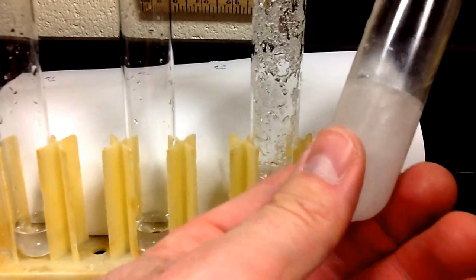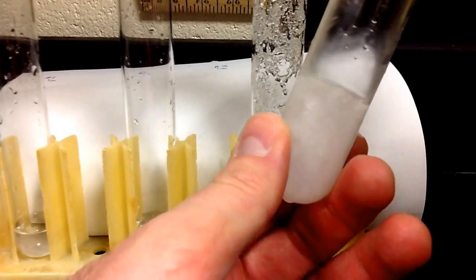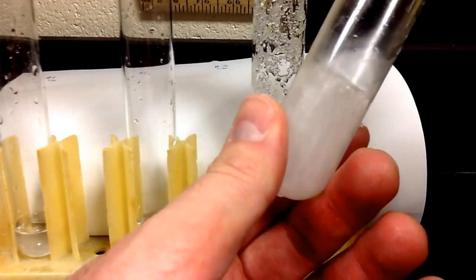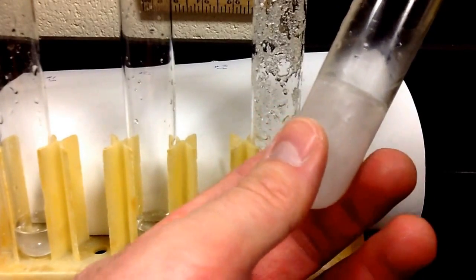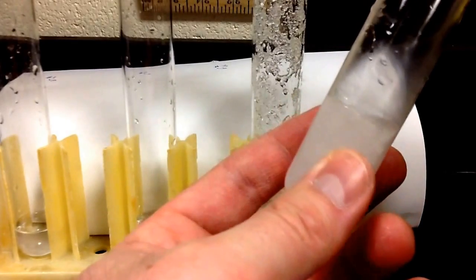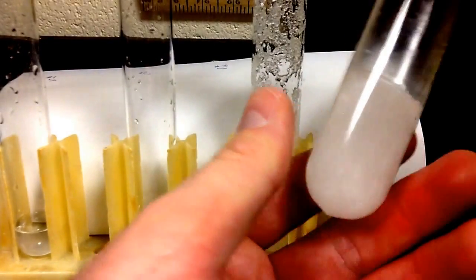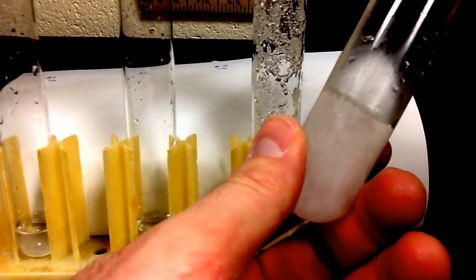So at this point, some people think we formed a solid. We did not. If we were to take a rubber policeman or something like that and move this around, this would be kind of a slush.